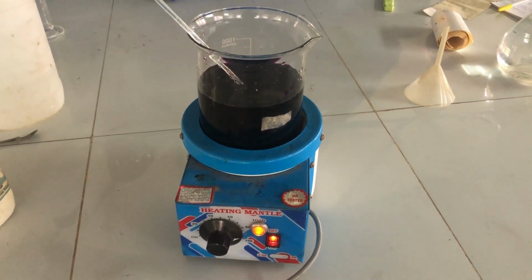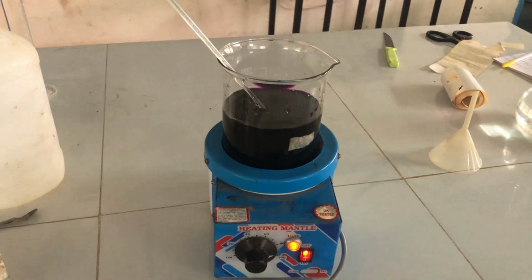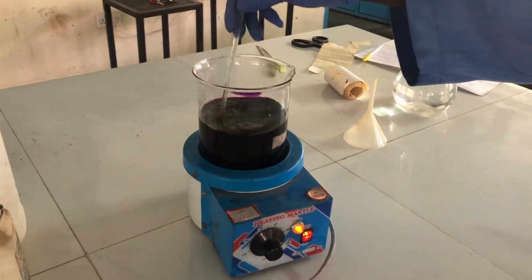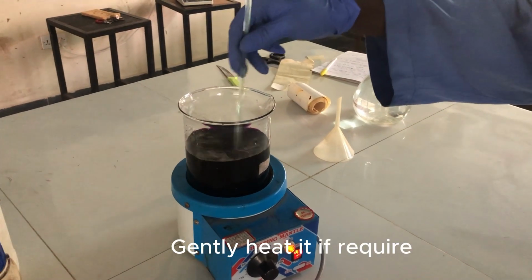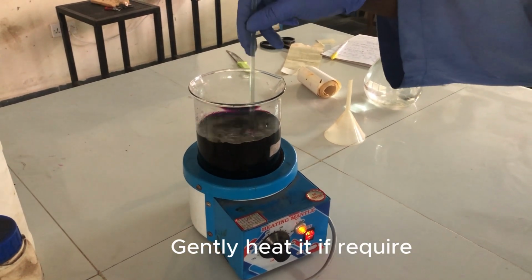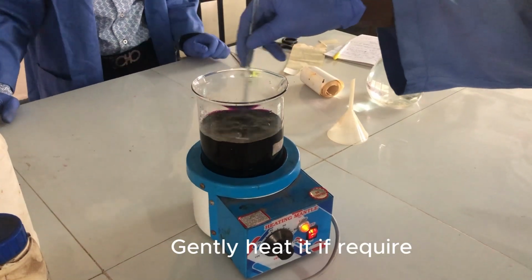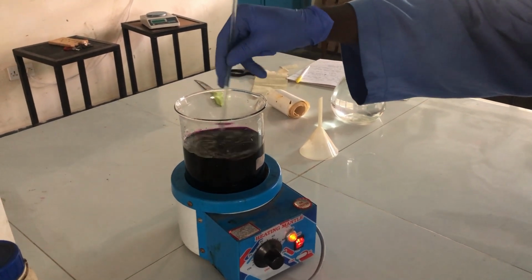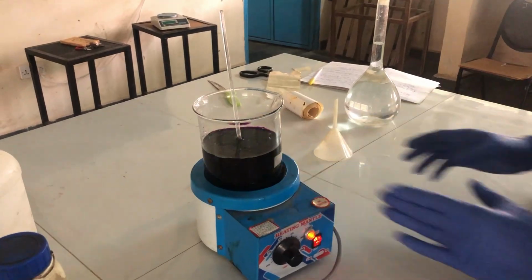Gentle heat, not that much heat, but gentle heating, to dissolve the particles. So let's leave it for a while.